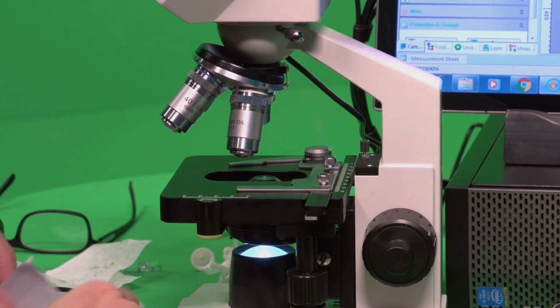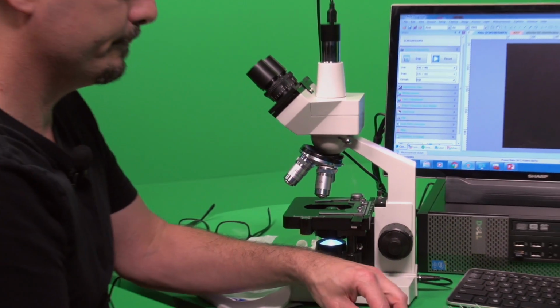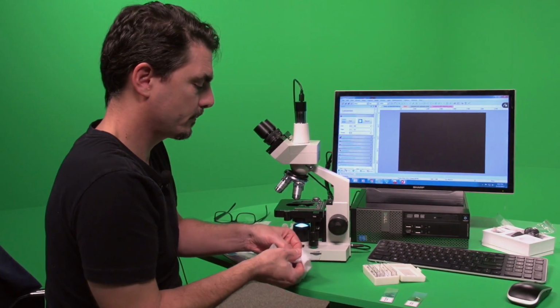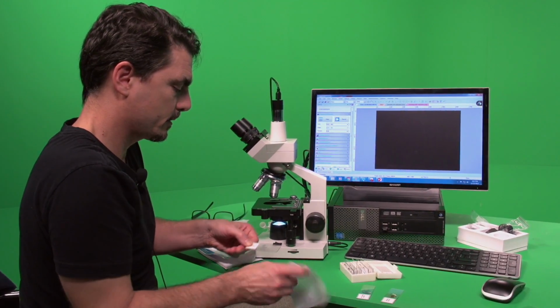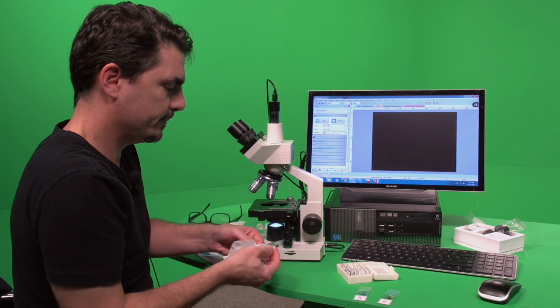And then let's go ahead and, for our slides, do the same thing. You want to get all the oil off before you put them away.